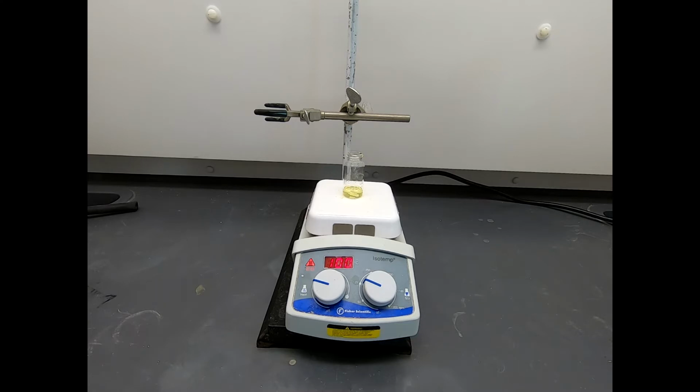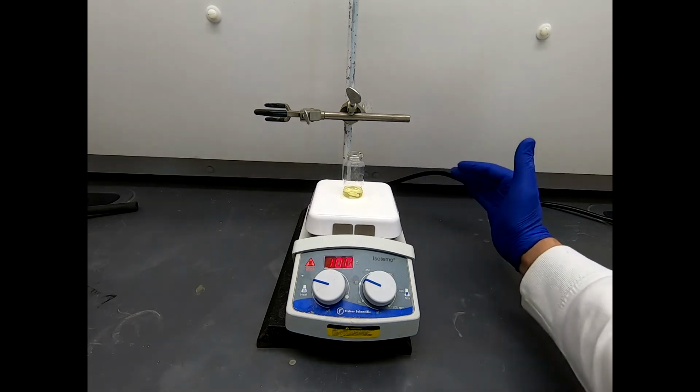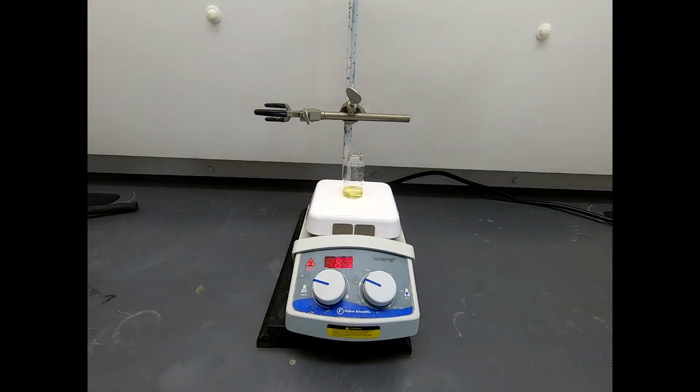And one of the great casualties of acids and bases in lab will be your clothing, because you'll reach across the benchtop and drag your sleeve, or maybe rub against the bench with your pants, and you'll find there was something wet there that wasn't water, it was acid. And then when your clothes go through the washing machine, you've got holes in your clothes. So just be mindful. You don't have to be fearful of chemicals, but you certainly have to respect them and what they can do, and take precautions to prevent that from happening.